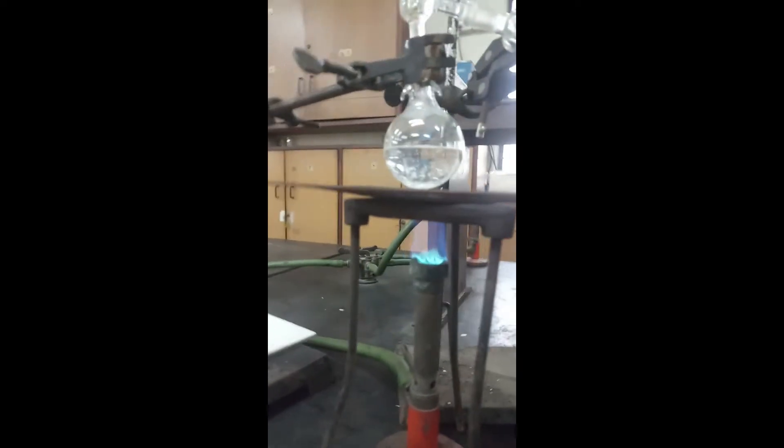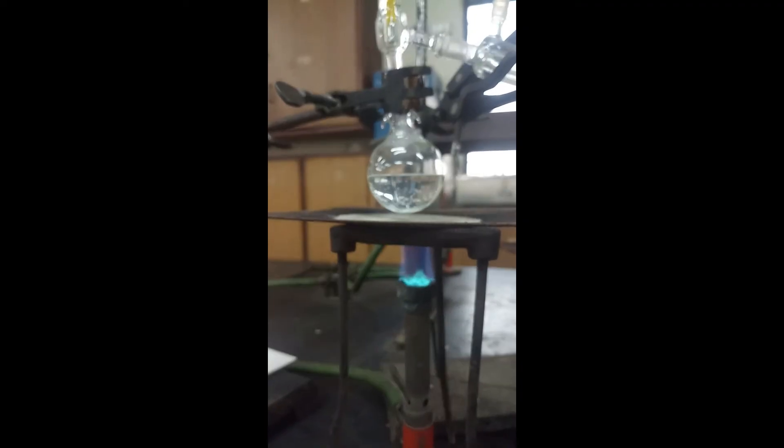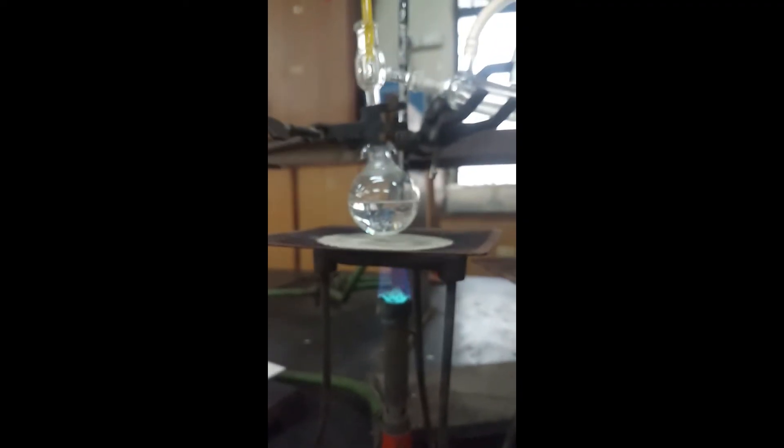Start the burner for heating the mixture.